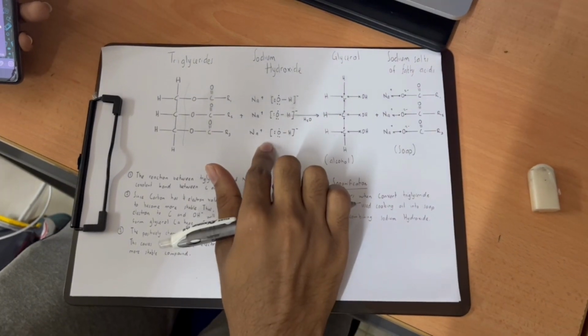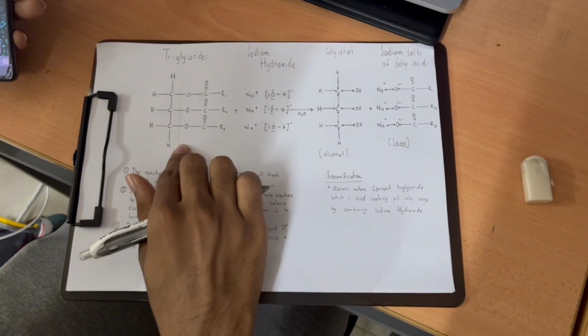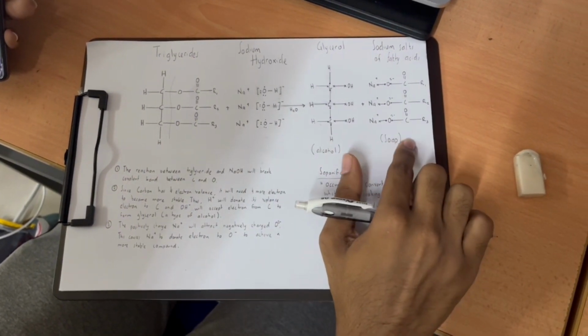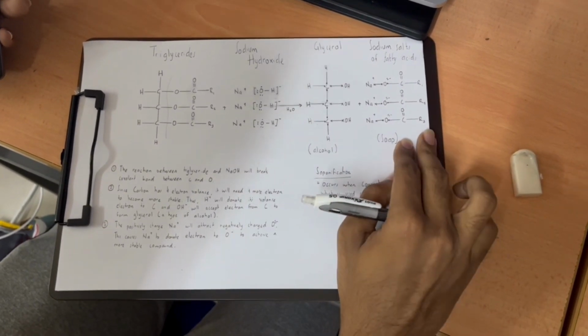The dissolved sodium hydroxide in water is the alkaline solution needed to react with the fatty acids in oils during saponification. The chemical reaction transforms the used cooking oil into soap. A well-dissolved sodium hydroxide solution promotes an efficient and complete saponification process.